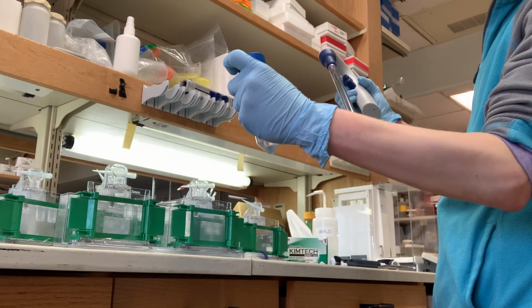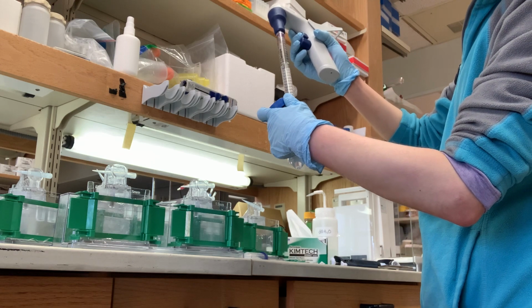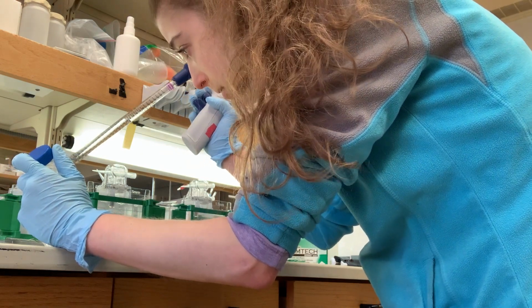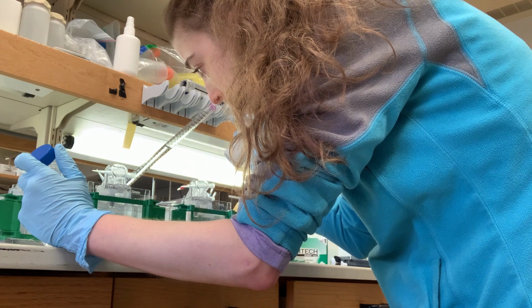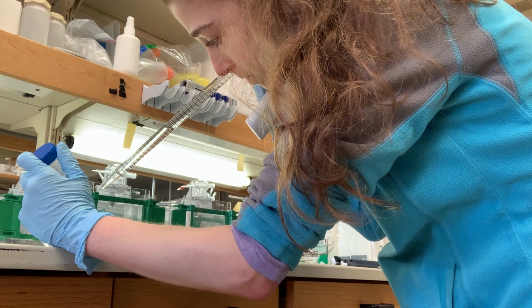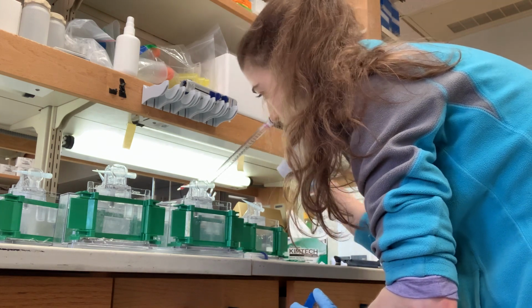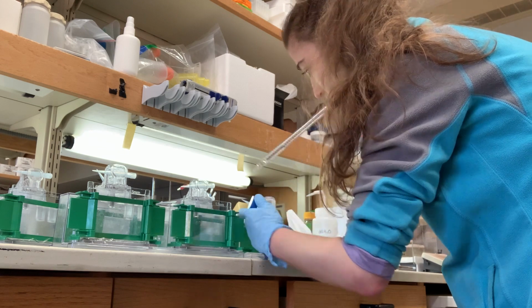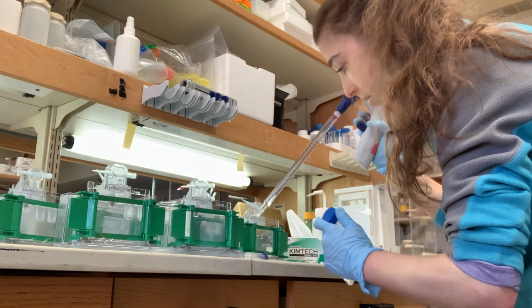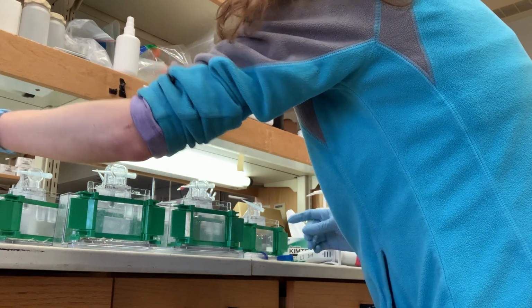So I've gotten the polymerization going. Now I'm going to put on the stacking gel. Just like before, except here I fill it up all the way to the top. I typically prepare 3.5 mils for a 0.75 gel, 7 mils for a normal gel of the running, and then 2 mils of the stacking.